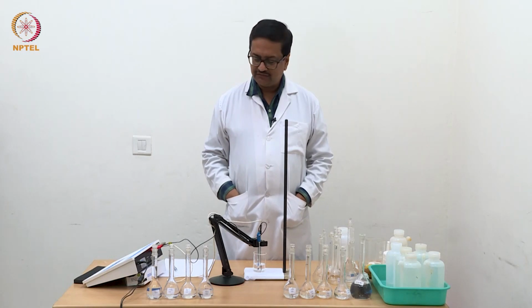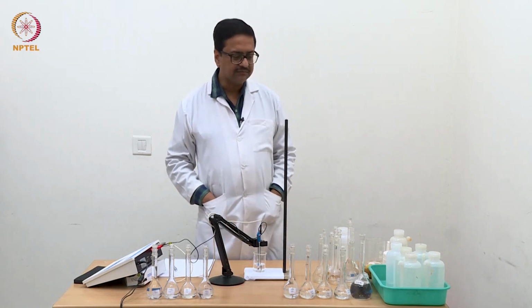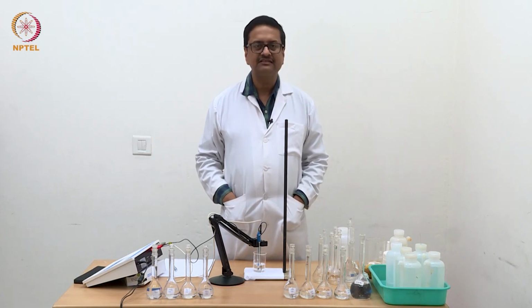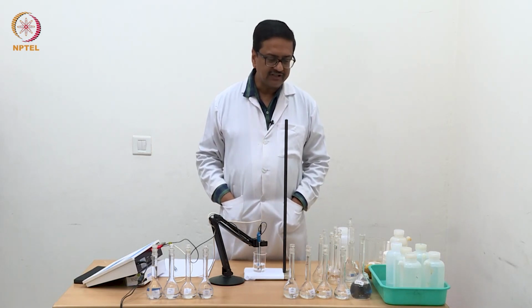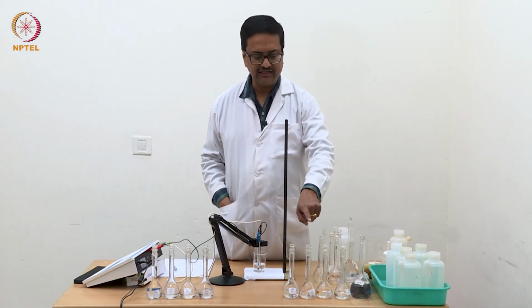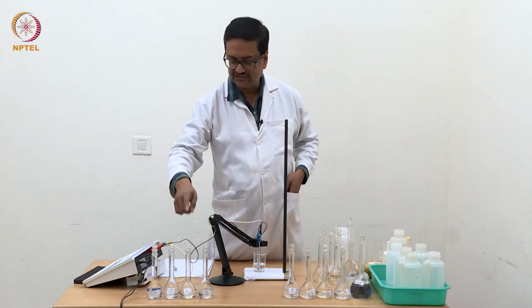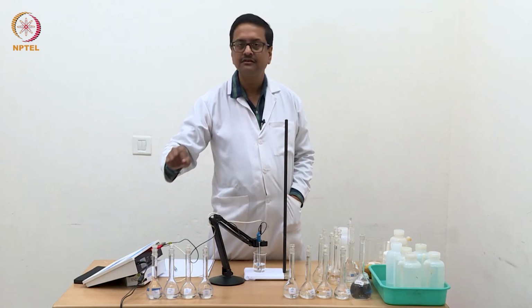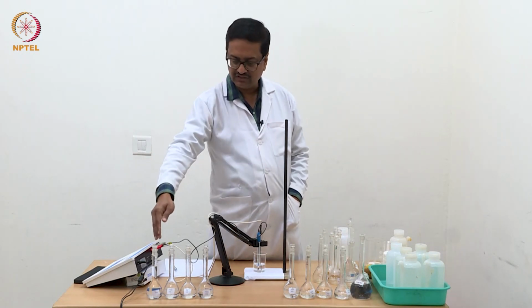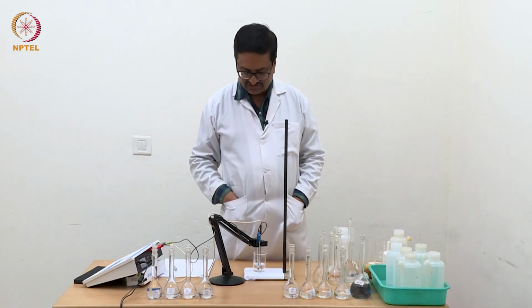Now we are ready with one set of solutions of HCl, which we have diluted from 1 normal HCl. As I have shown you in the previous section of the video, I first prepared N/2, and from that we prepared N/4 by half dilution, then by half dilution N/8, N/16, N/32, N/64, N/128 and N/256. On my right, which is on your left on the screen, is the lowest concentration, and on the other side is the highest concentration.